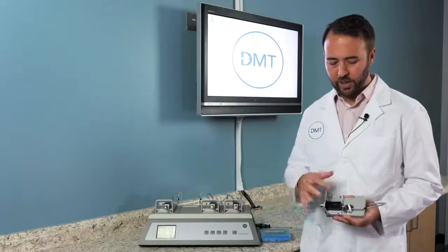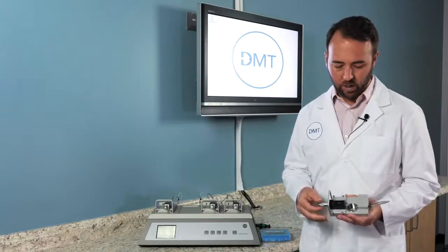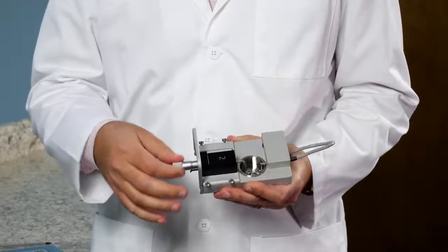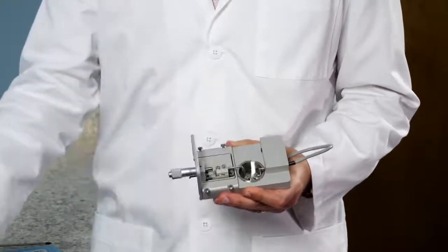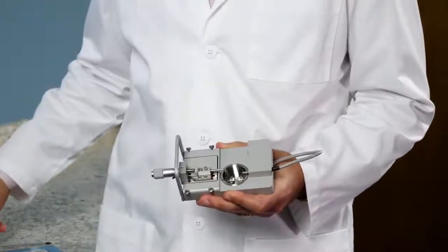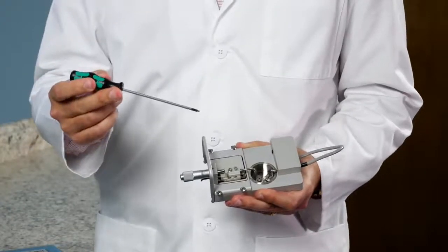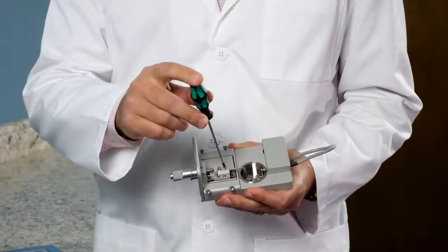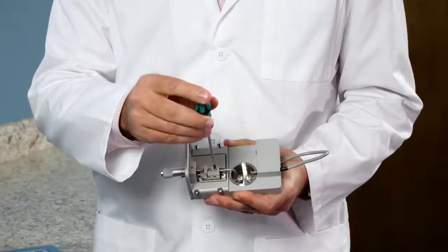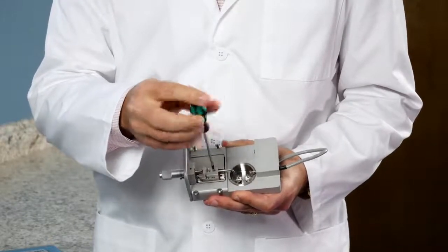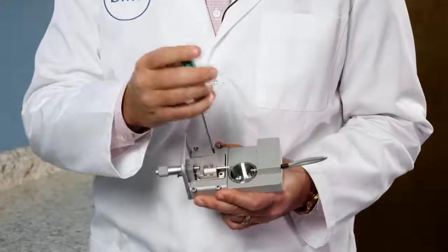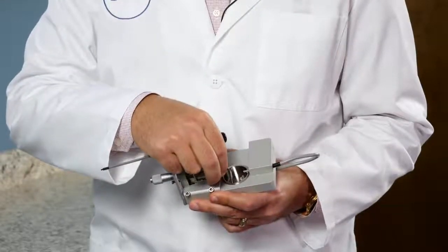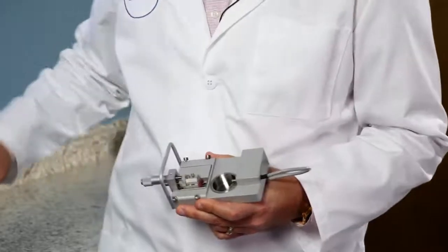In order to change from jaws to pins, you need to separate your mounts, remove the chamber cover, use your ball end screwdriver to loosen the first screw closest to the chamber. Loosen that and then you can remove the jaw mount.